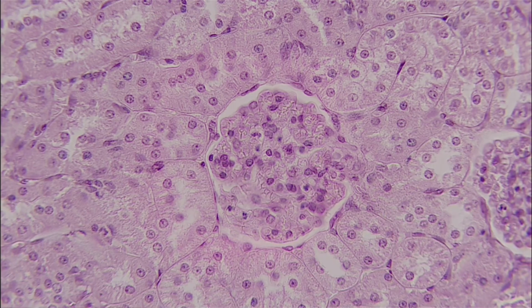And what I mean by that is that epithelial tissue typically lines a cavity or is on the surface. And so we're looking for where that kind of basement membrane is to where that cavity or surface is. And so we can see here that this right here is going to be that basal surface. It's kind of this dark line that goes all the way around. And then our apical surface is going to be facing this lumen right here.